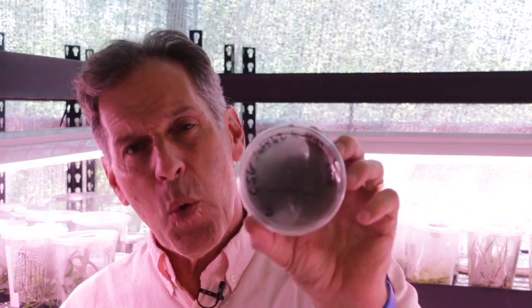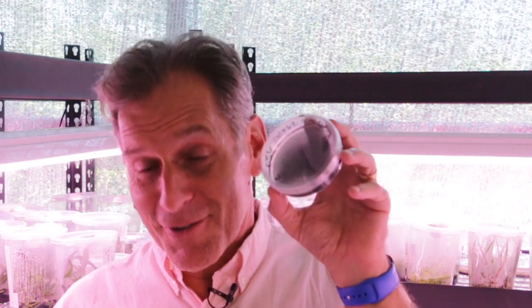But there's about 20 protocorms forming on this plate from, like I said, a total of maybe 10,000 seeds in this plate. And I've got a few other plates, so I'll get enough plants, but there's really, really low numbers of embryos that are in here, but they're doing okay. Now, sometimes the embryos will form, they'll form protocorms, but then they'll continue to proliferate and it won't look very good. So, but at this point it's promising.